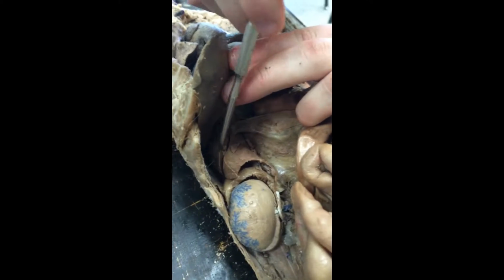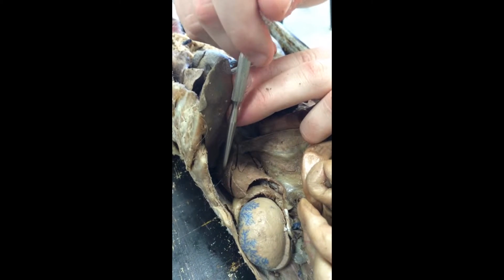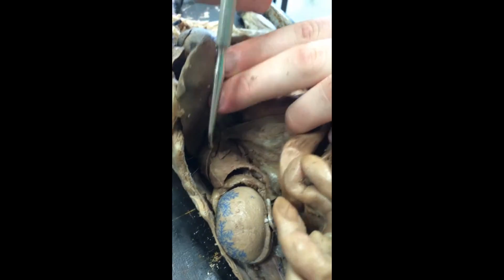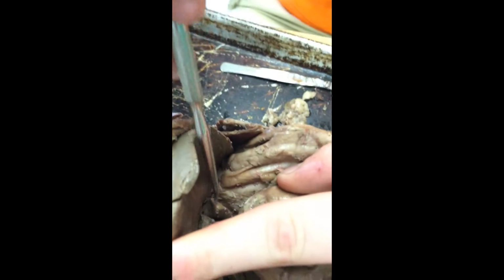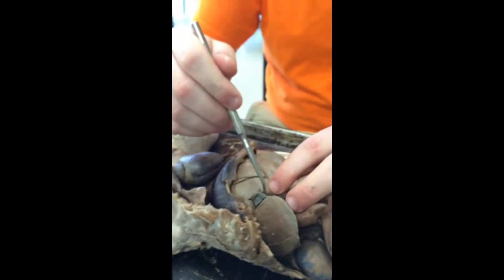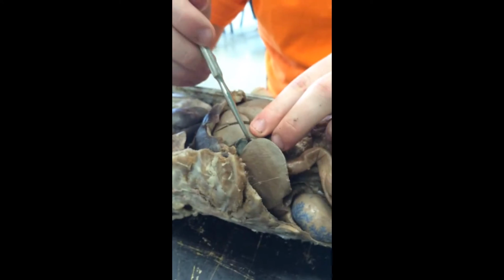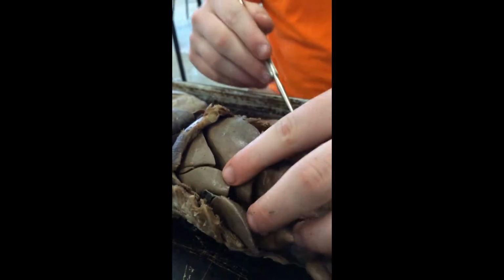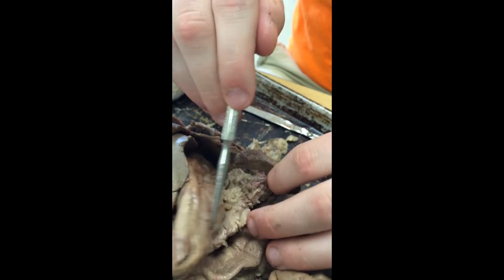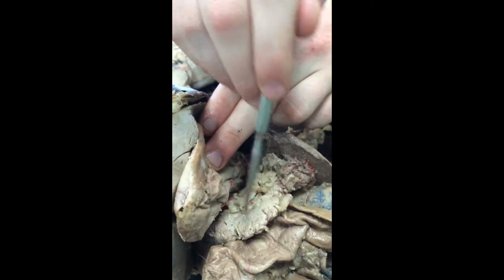This one right here is the right lateral anterior lobe, and we have the right lateral posterior lobe right here. And one more lobe is this little guy right here. He is the caudate lobe. And in between the lobes of the liver, we have the gallbladder, and we also have the spleen, which is right here, this part. And then underneath the stomach, we have the pancreas.